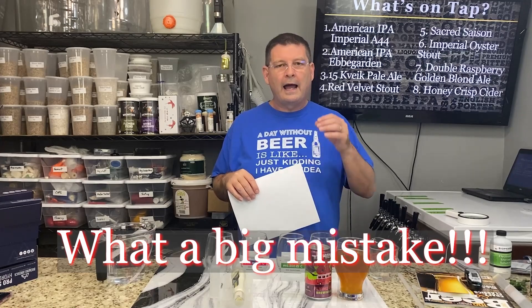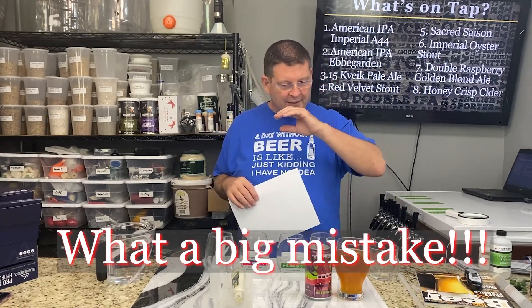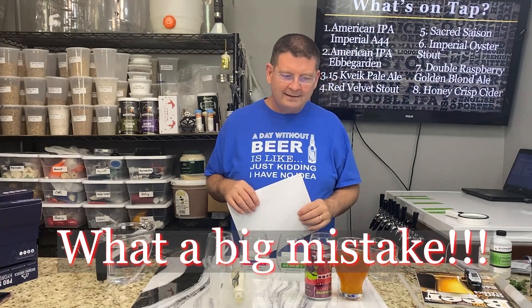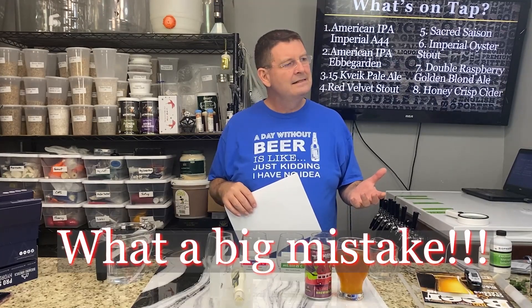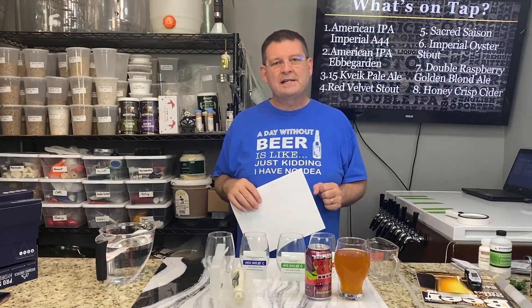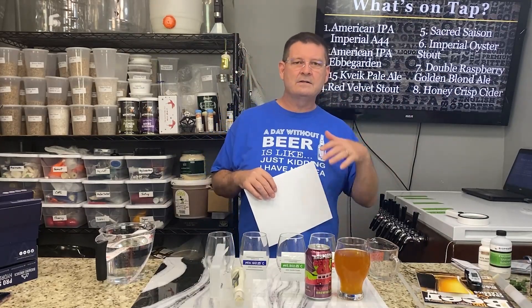It was so wrong. I went to bed after calibrating it, and woke up thinking it didn't make any sense — how did it save any settings? Then I was doing some testing and the numbers were just way off. I'm adding more alkaline and it's not going up. I'm adding more acid and it's not going down. Something was not right.